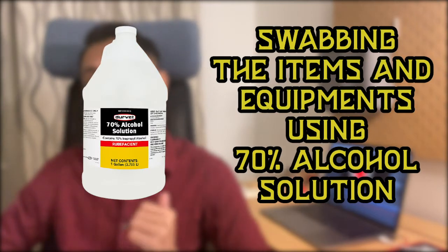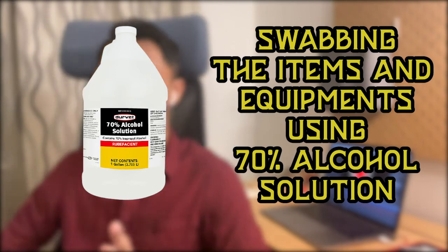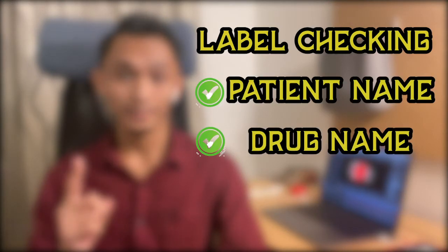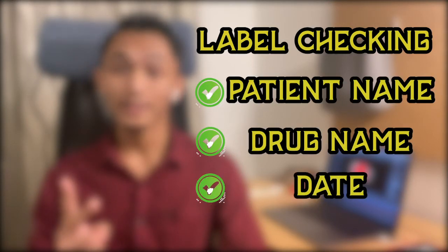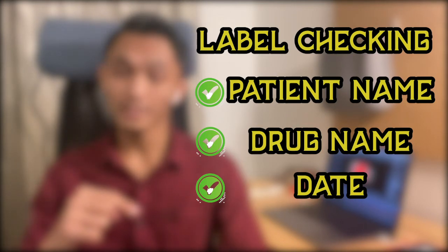We will then enter into the preparation room. Inside the preparation room, we will help with swabbing the medications and equipments using 70% alcohol to sterilize. We also do some checking on the labels to make sure that the patient and the medications are correct. This needs to be done before we pass the medications and equipment into the CDR preparation room.